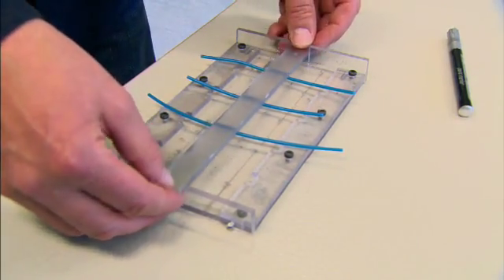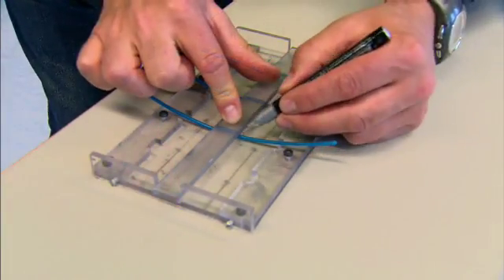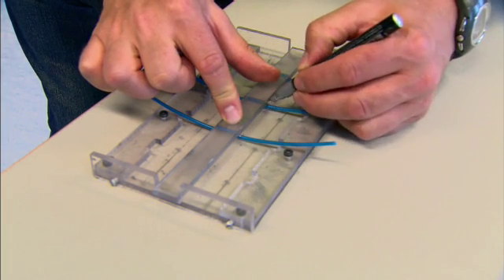Mark two references with a thin silver pen, 20 millimeters apart, measured from the center of the sample.